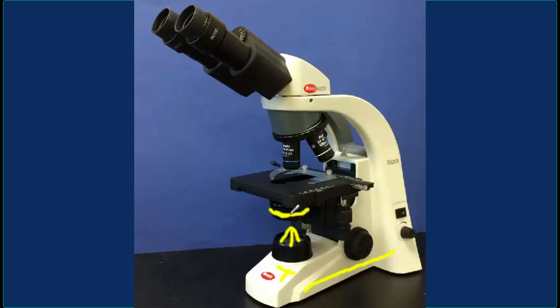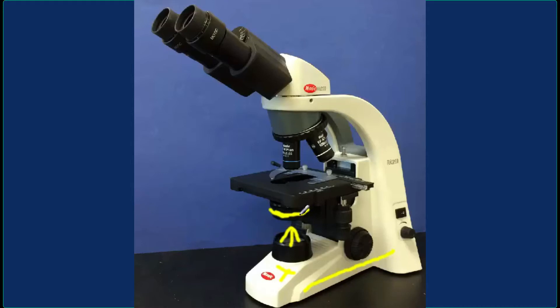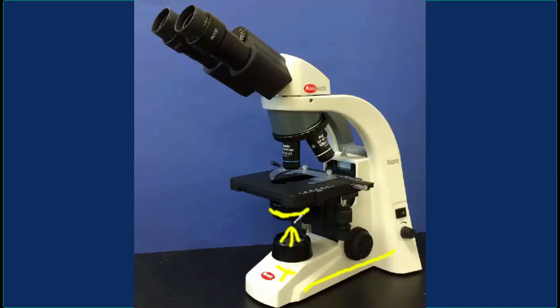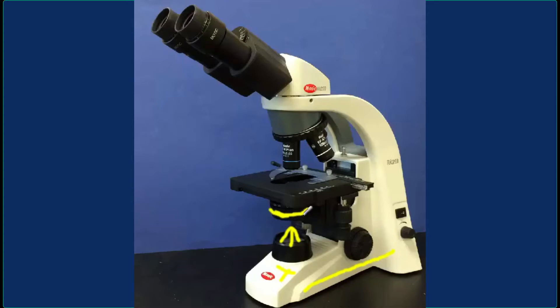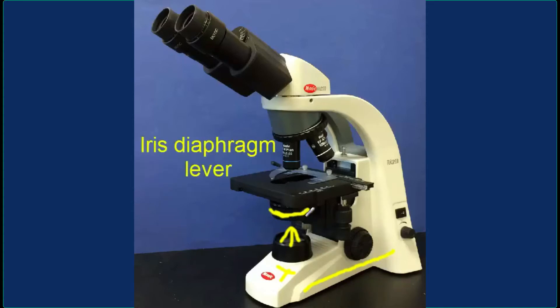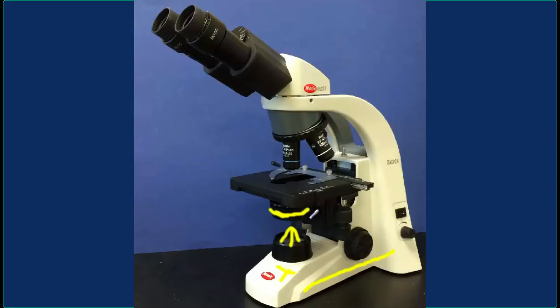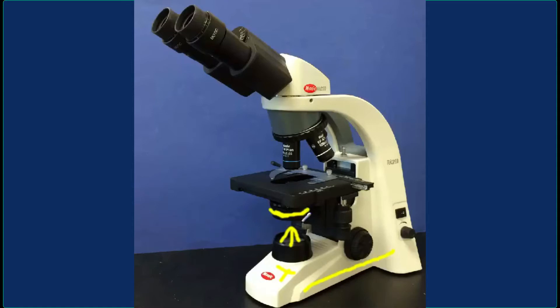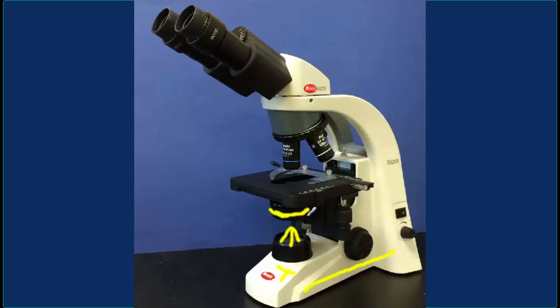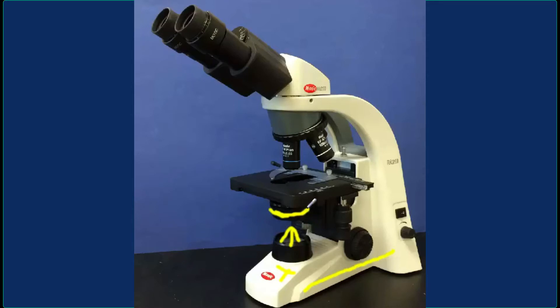The light is going to be going through, and there is also a lever associated with this housing called a diaphragm lever, because it controls a diaphragm or screen that can adjust the amount of light going through the condenser lens. This is one way you can enhance contrast or optimize the lighting going through the specimen.